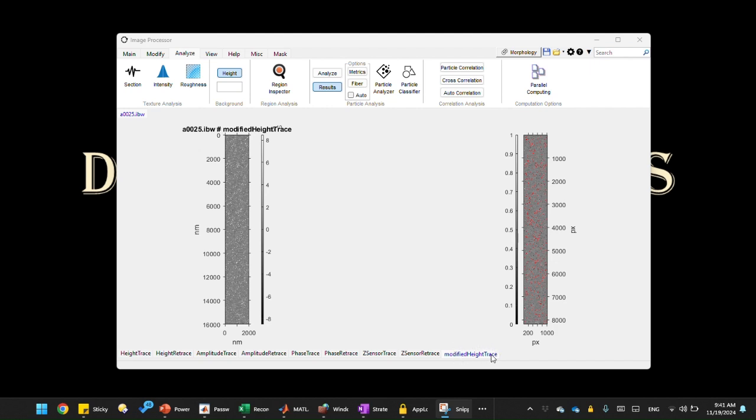When you perform those operations on the height trace channel, for example, it gets a new channel called modified height trace. We're going to use this data channel as our base image to create our mask from. So we need to create a new channel out of this one, and to do that, we right click this channel and click duplicate current channel.